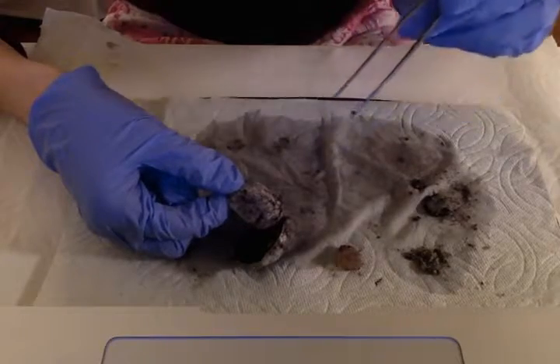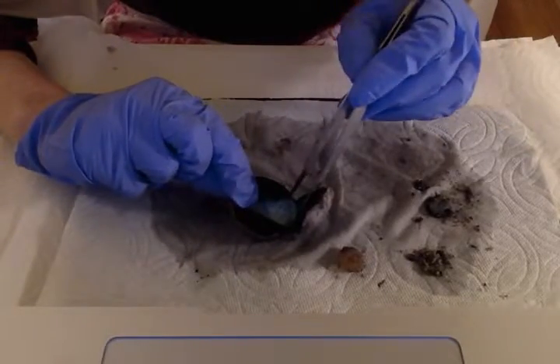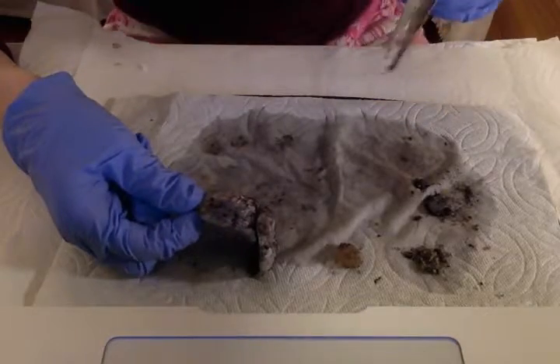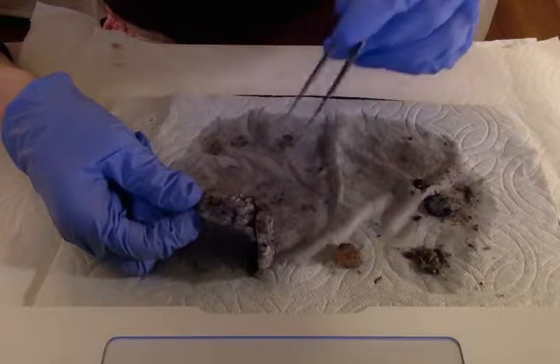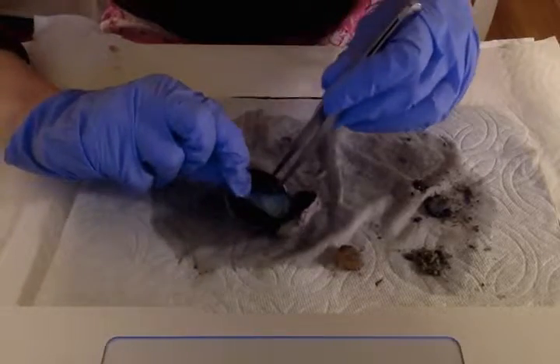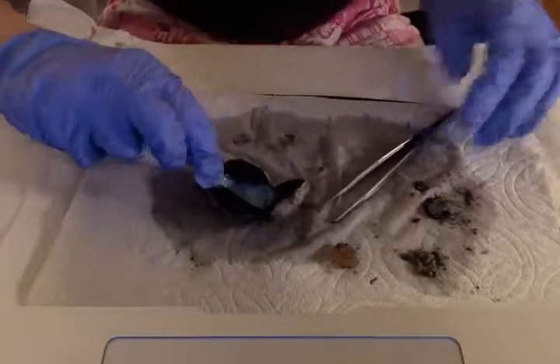So basically, photoreceptors in the retina are going to receive the light energy. They're going to convert the light energy into electrical signals. Then the optic nerve right here is going to dispatch these electrical signals to the visual cortex, which is a part of the brain in the occipital lobe that interprets these electrical signals as images. So again, optic disc is right here, and then it runs through, and perfectly on the other side, you can see the optic nerve. All right, bringing this back up.